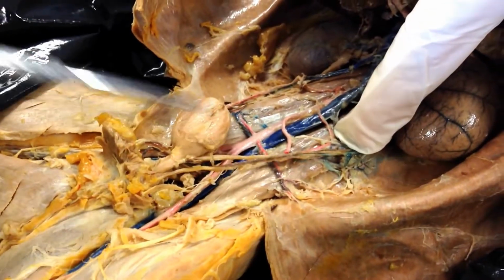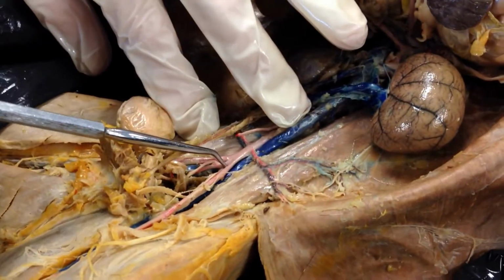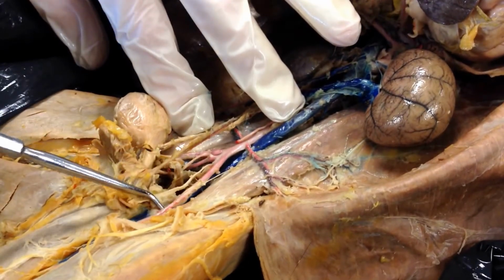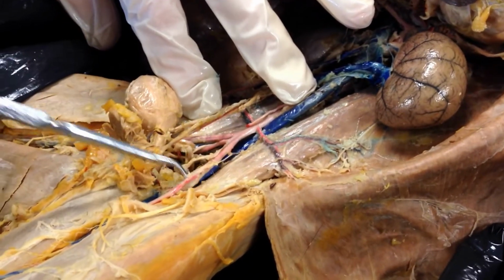Next one on your list is the Iliolumbar, same spot as the vein, the red and blue in the lower back, Iliolumbar artery and vein. The external iliac is this branch that goes from here to all the way down to here. So it's this section here. It's called the external iliac. This little piece here is called the internal. It's not one you have to know. This is the external iliac.